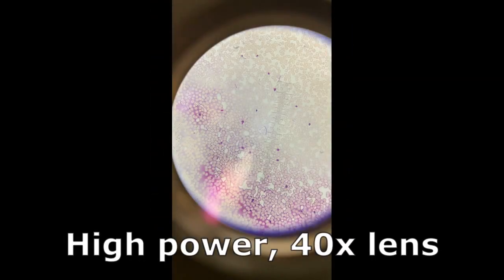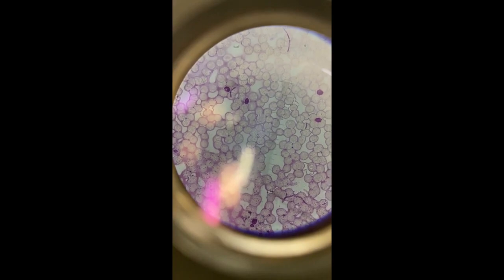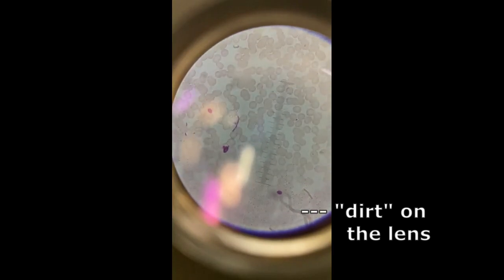Here is what that looks like through the lens. You can look around a little bit, but you can't go too far because you need to stay within the oil on the slide. You can see material in the view that moves with the lens instead of with the sample. This means that material is stuck on the lens and not part of the sample. These colors are a result of the recording.